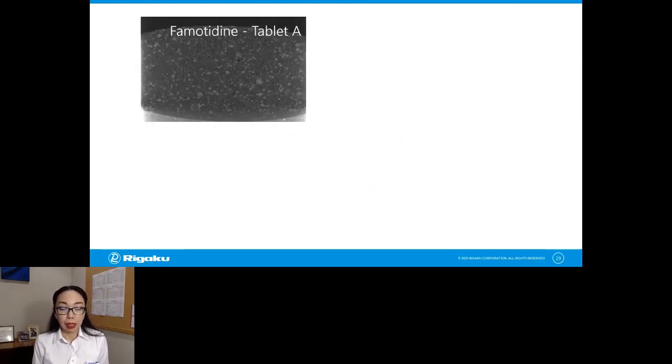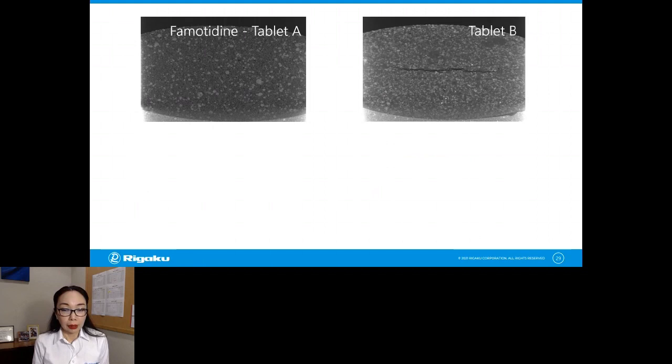This one is a famotidine tablet. Let's call it tablet A. This one is a very clean tablet. I don't see any cracks or aggregates. This one, another famotidine tablet, B, has actually a huge crack in the middle of it. And if you look at it closely, you see kind of dark, large areas, and those are probably aggregates or some non-uniformity in the mixing process.